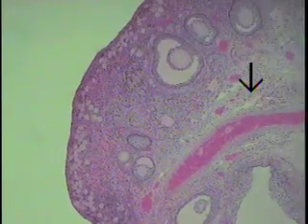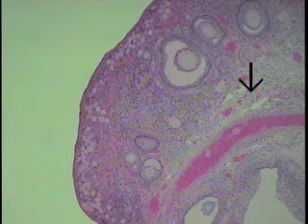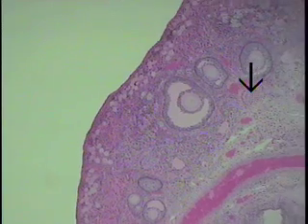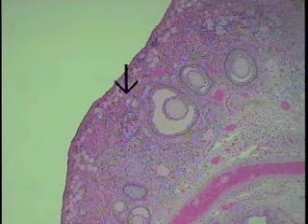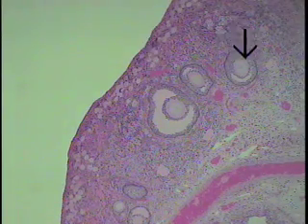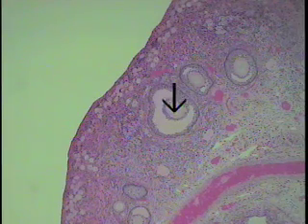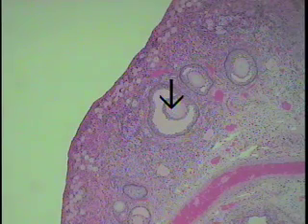In this area of the cortex, one can perhaps see just a little bit better the very early young primordial follicles, some growing follicles, and a little bit more mature follicles here, known as secondary follicles.